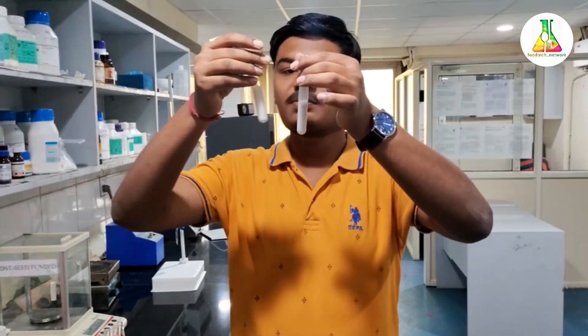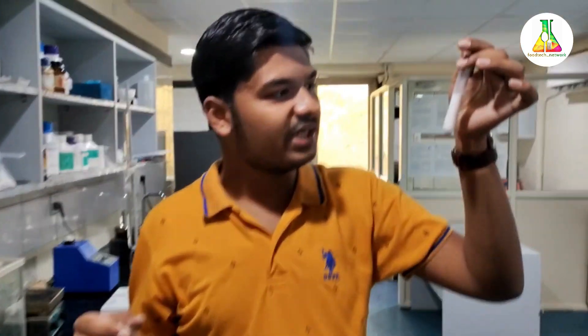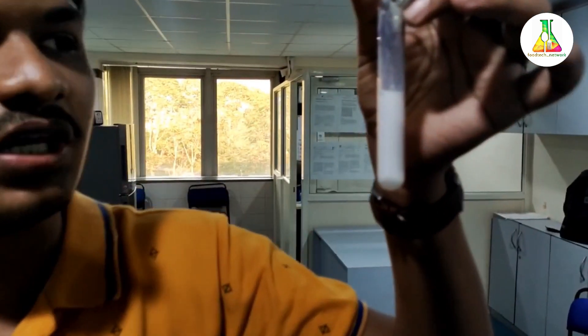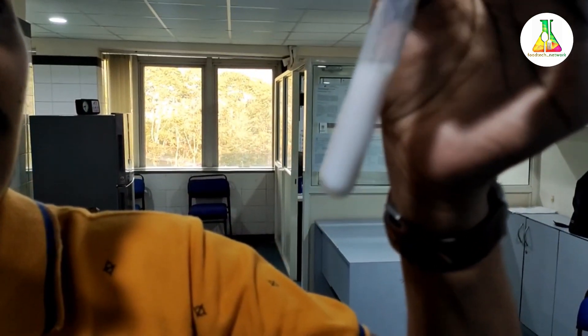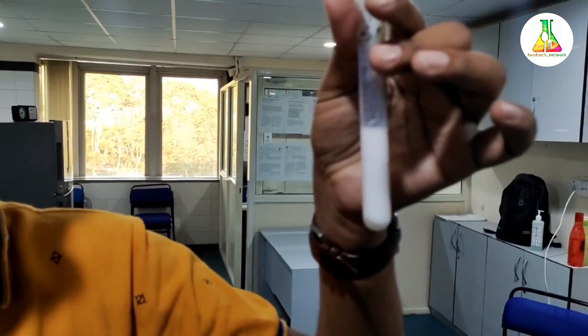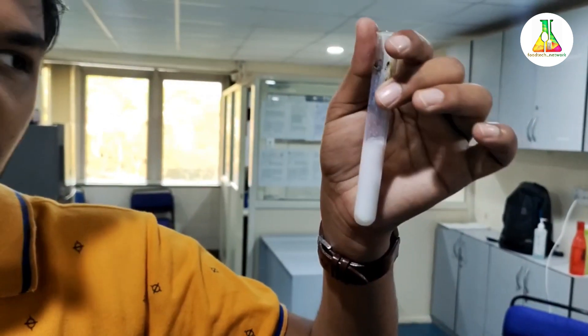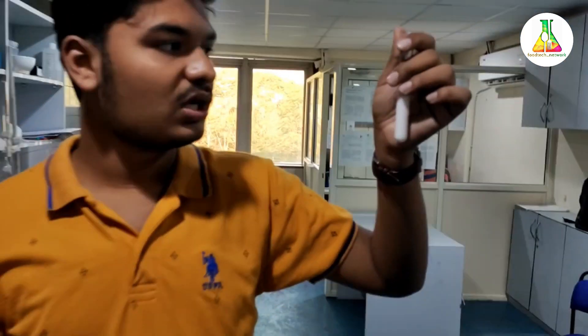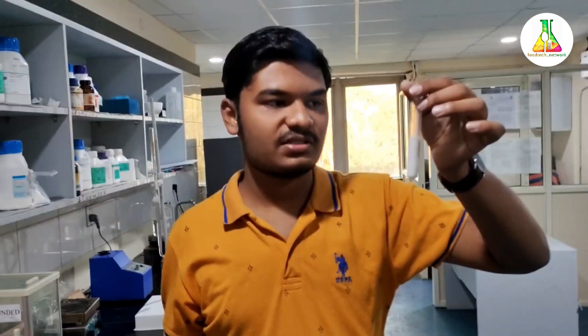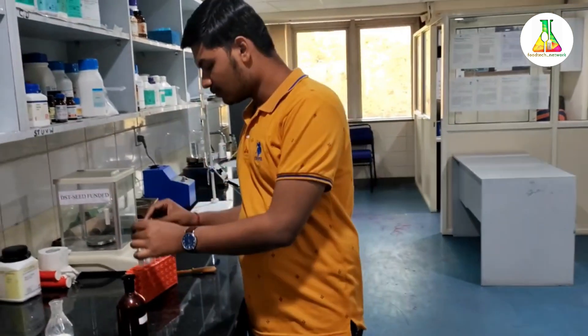As you can see, among both these solutions, this one is getting a little bit of a deep or pale blue color, and it would gain color within a passage of time. As I've already told you, the complex formed between starch and potassium iodide is a function of temperature, so as this solution cools down it would gain a deep blue color, signifying that starch is present in it as an adulterant. So this was all about today's video.